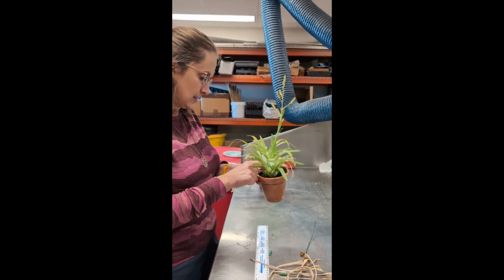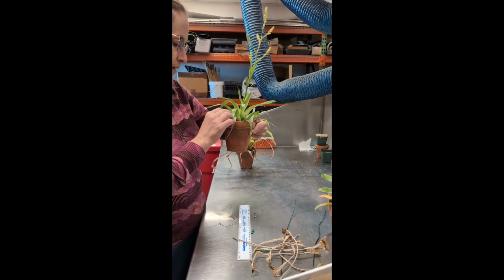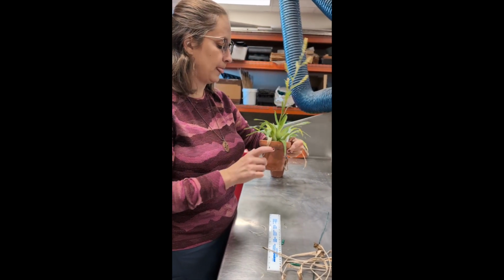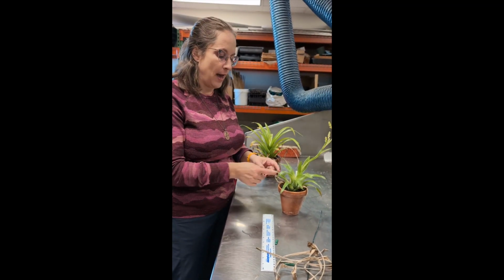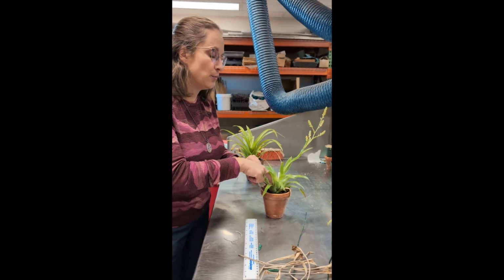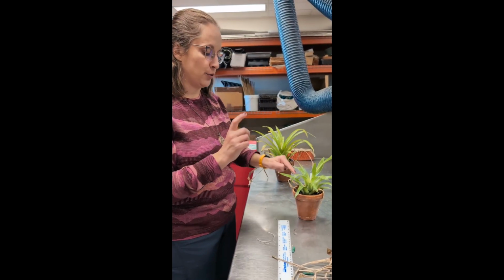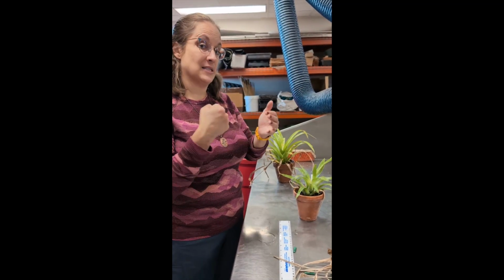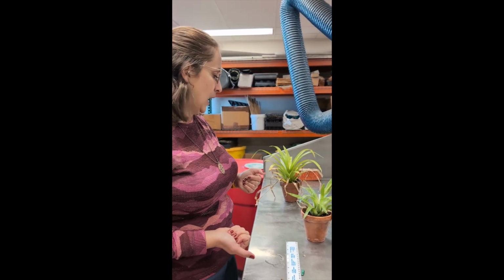This individual, I see 1. And I see 2. And again, it's so big and dramatic, right? Don't stress about getting in there too much or pulling it apart. That's going to cause more damage to the plant. Production of these, as well as production of the inflorescence, happens fast and big in these plants. So you're going to see it if it's there.